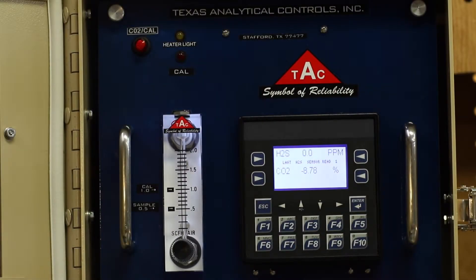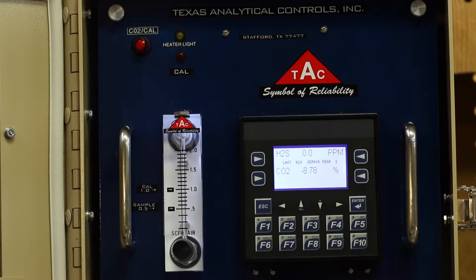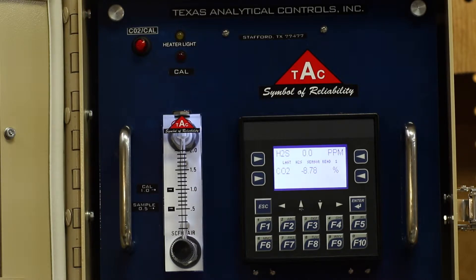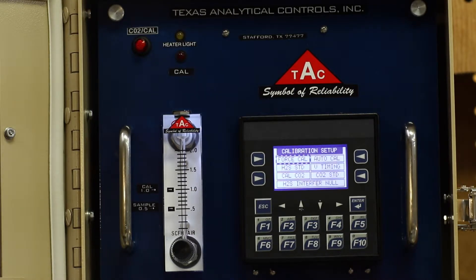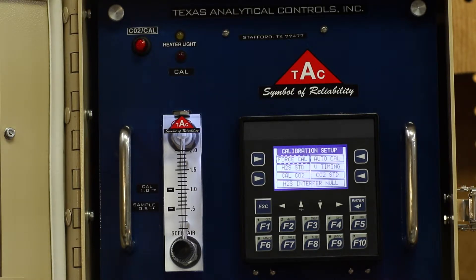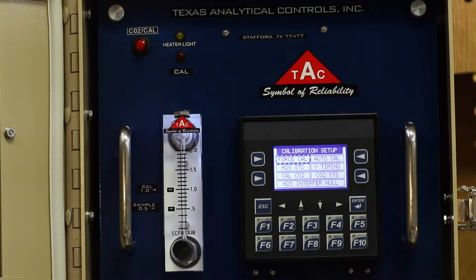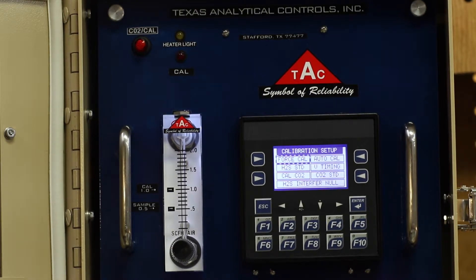Hi, I'm Dean. Today we are going to be calibrating one of our CO2 analyzers. This analyzer is configured to measure H2S and CO2, but in this video we are going over the calibration of the CO2 portion only.